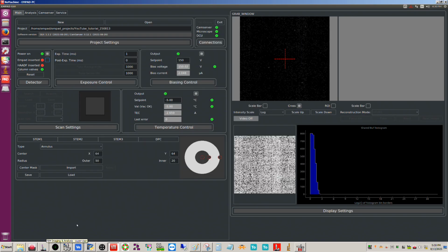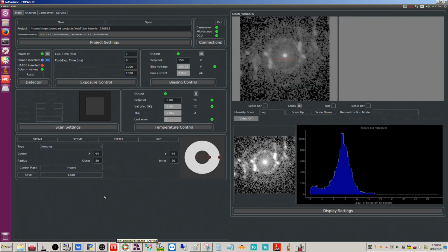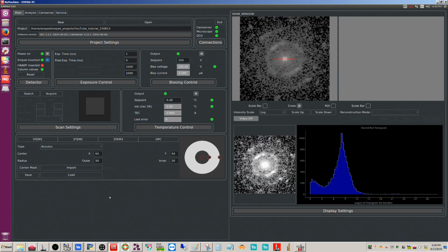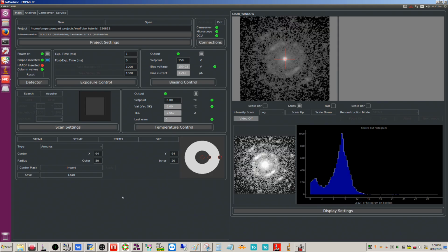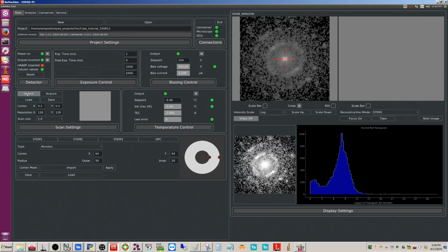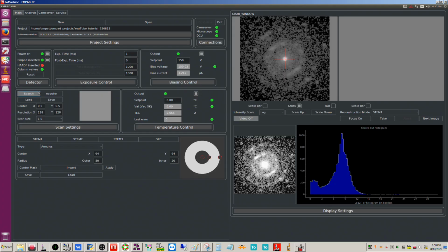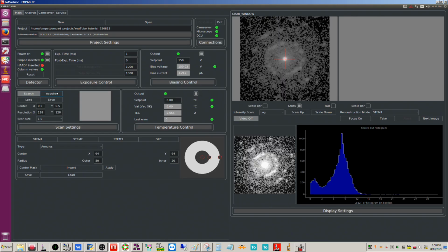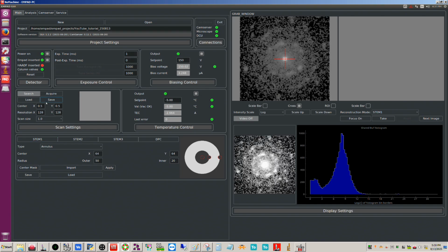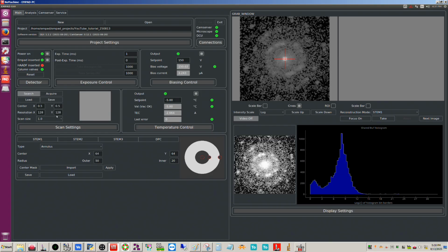All right, let's put the MPAD back in finally, and we'll go ahead and give control to the MPAD now. Over here where we click search, there are two settings: search and acquire. You can set these to be whatever you want. Whichever one you have activated, you could use to do your final acquisition. Generally speaking, though, we use search and we use the full frame at a low resolution.